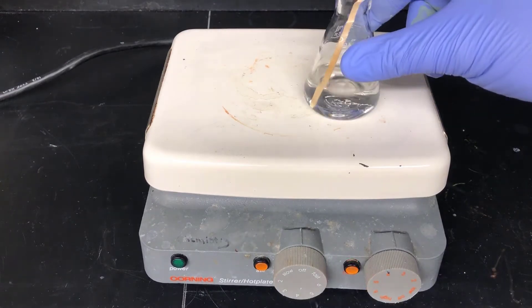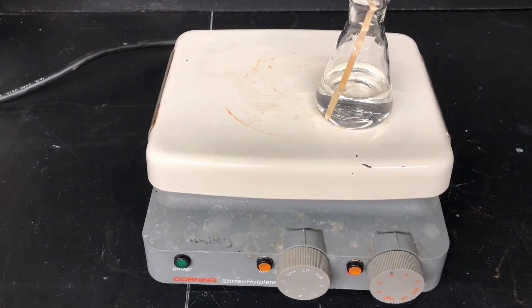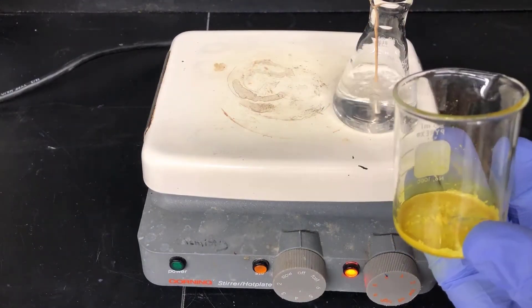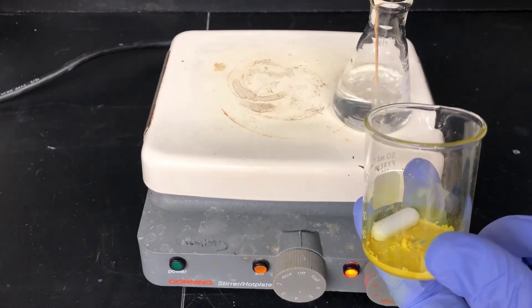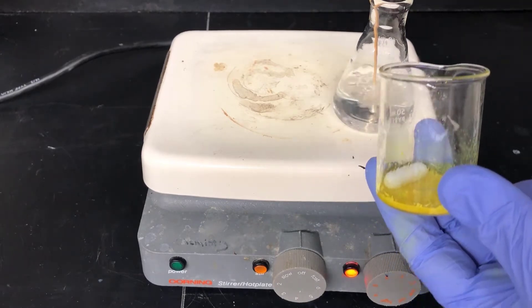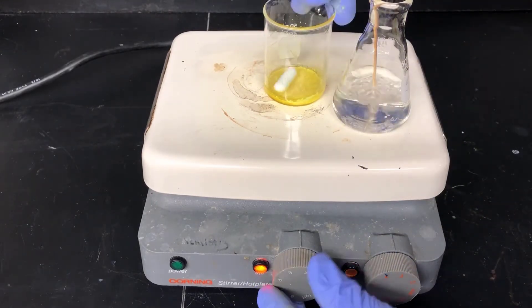To start, I put some isopropyl alcohol in an Erlenmeyer flask and placed it on the hot plate with a boiling stick to smooth out the boiling. Now I'll take the crude product in the beaker, add a stir bar, and then add some of this boiling isopropyl alcohol. I'm adding a few milliliters so that when I put the beaker on the hot plate it won't overheat—it'll just go to the temperature of the boiling solvent.